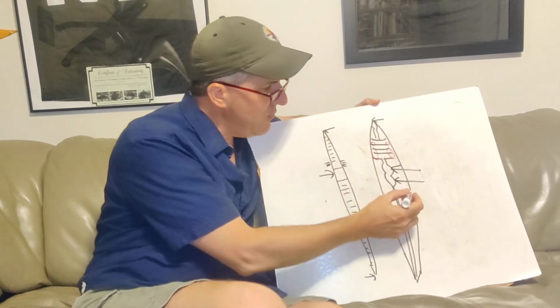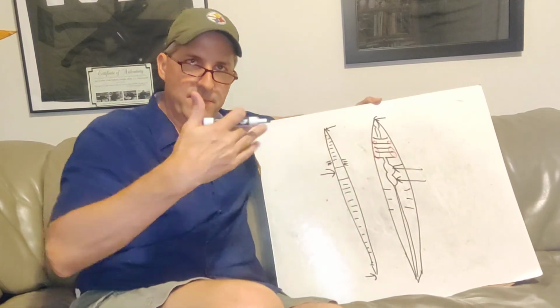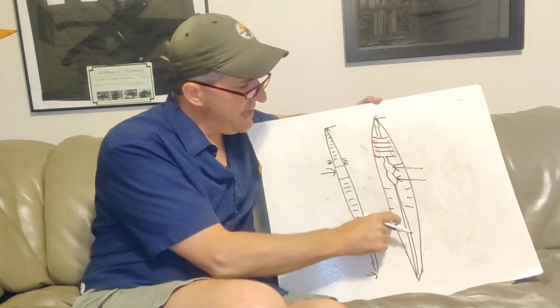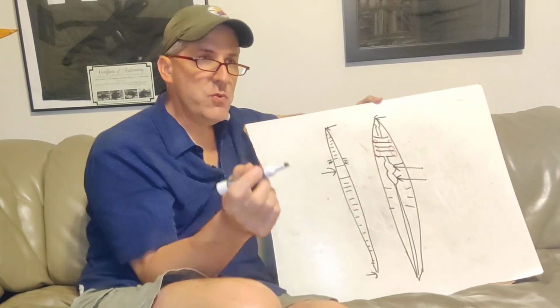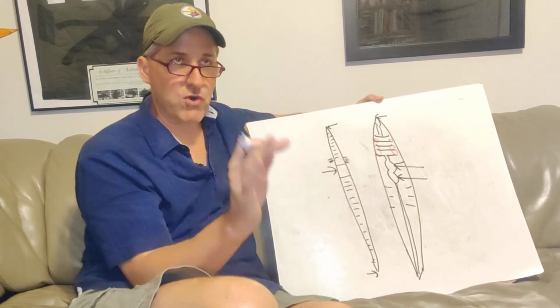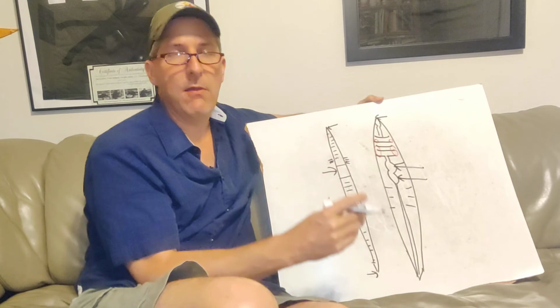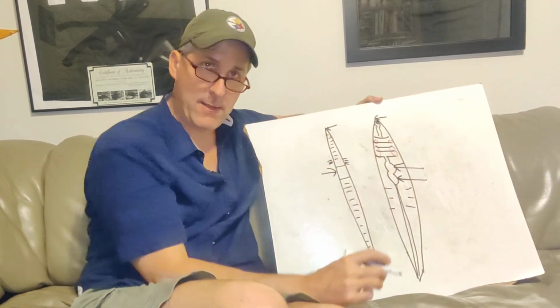On the inside, then, what you would see are kind of like these white ribs going all the way back. That's the metamerism, the segmentation. What I would then tell you to do, last thing to do, would be to take the intestines and with your probe, push it to one side. You would see this bright, and I mean bright white thread that runs right below it all the way down. That's the ventral nerve cord. It's going to connect the brain up here all the way down.